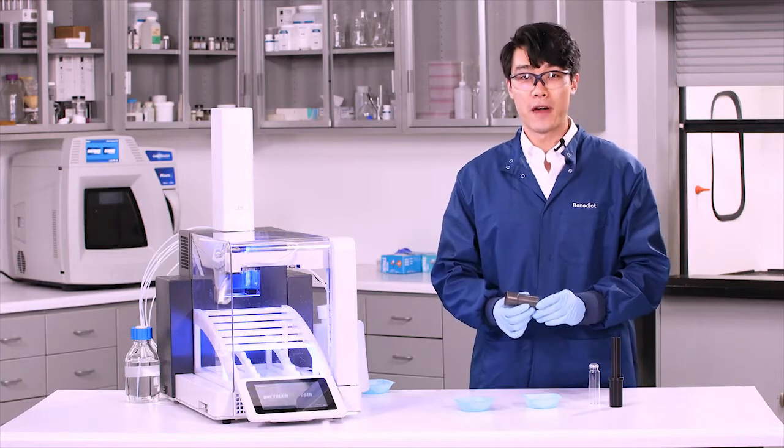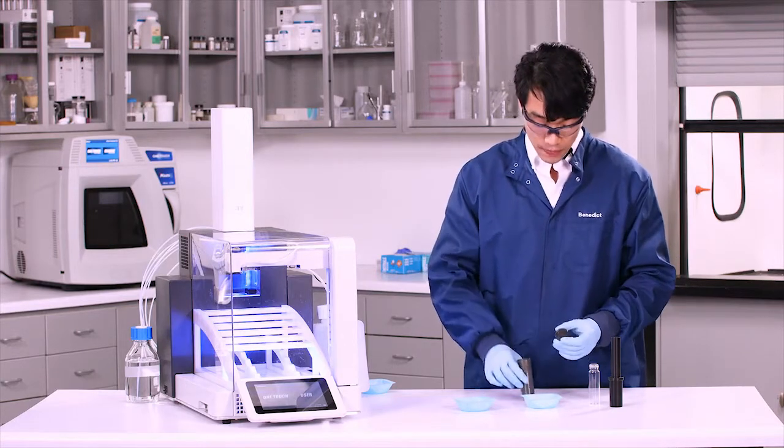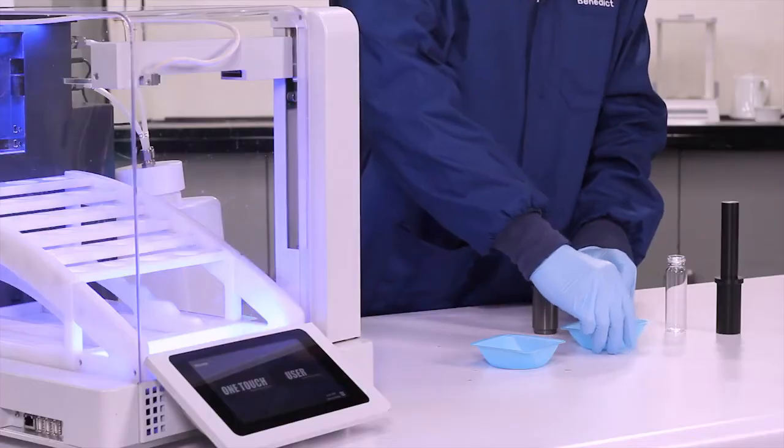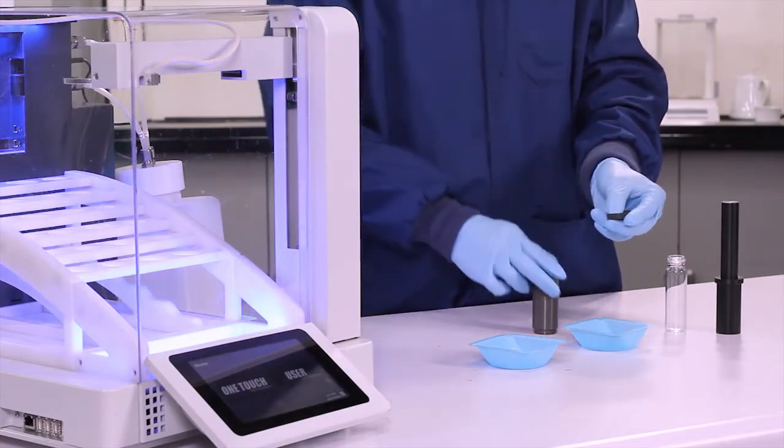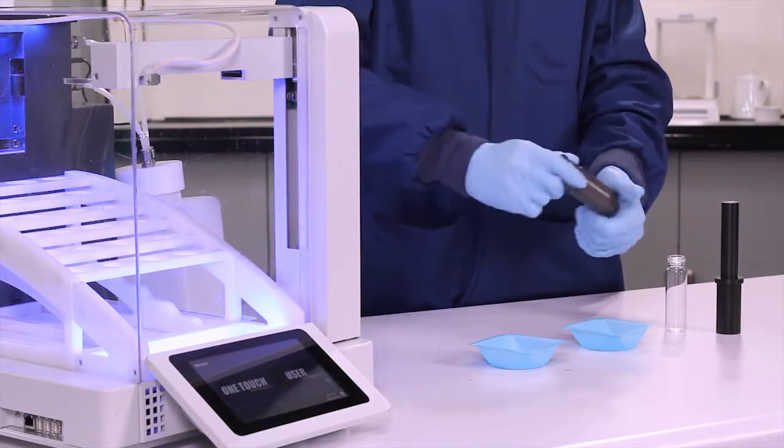So next thing we're going to do is we're going to go ahead and assemble our Q-cup. So we're going to take our Q-disc, using our S1 stack this time, going to place it into the base of our Q-cup, screw to assemble.